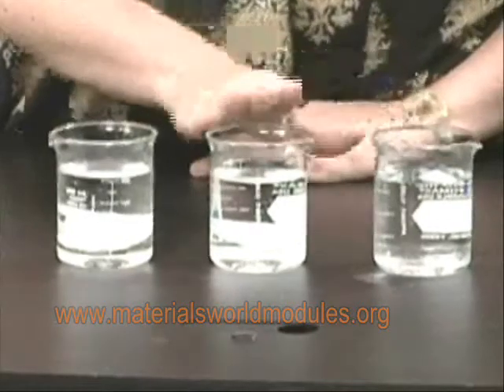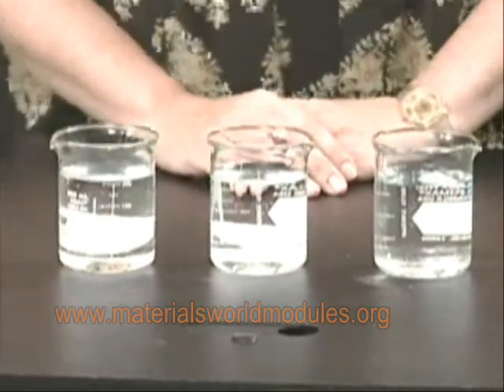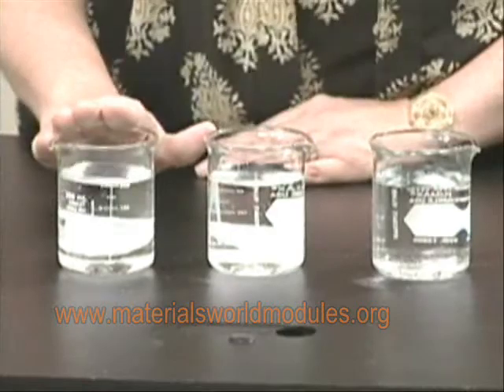Activity 5 is the key activity in the module. Students see the relationship between different polymers and their ability to absorb water. Slides or watch glasses of three different polymers — polyvinyl alcohol, polyvinyl acetate, and polystyrene — are cast, allowed to dry, and then soaked in water for a period of time. The masses before and after soaking are compared, and students see that the polar polyvinyl alcohol totally dissolves in water, whereas the nonpolar polystyrene doesn't absorb anything. This is usually where students start their thinking as they begin to plan their design.